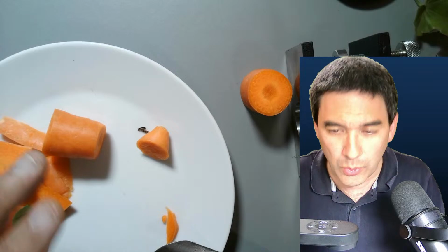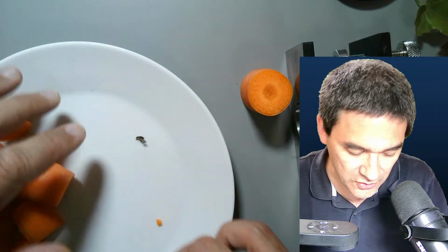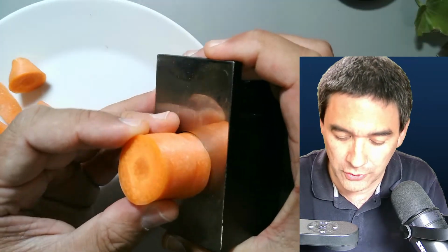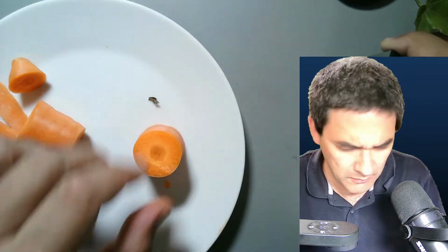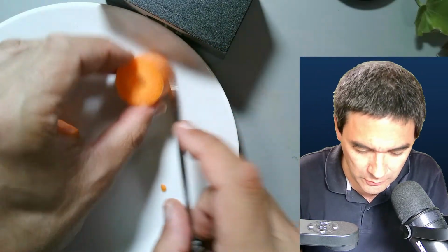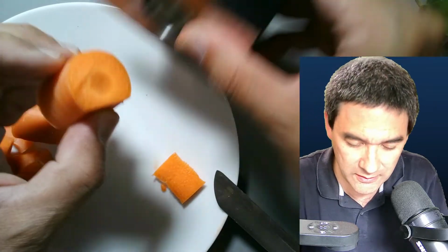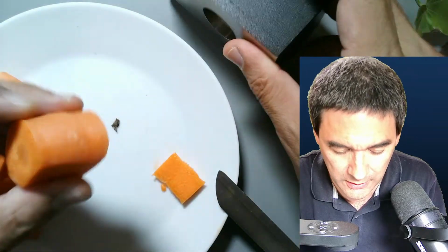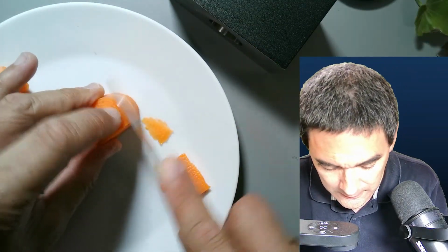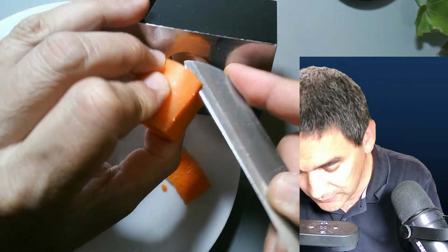This, by the way, in case you were wondering, is a document camera. It's actually one for taking pictures of books and so on. And I will now have to try to estimate the size. Maybe I don't have a ruler with me, unfortunately. But I'm going to estimate the size to be like this. Yeah, this seems to be working. Okay. And over here as well. I know it's kind of difficult to show you now.